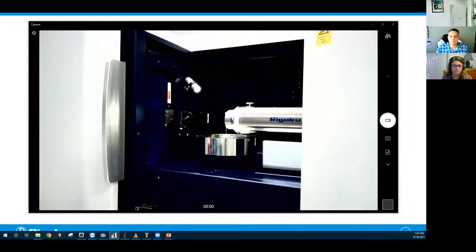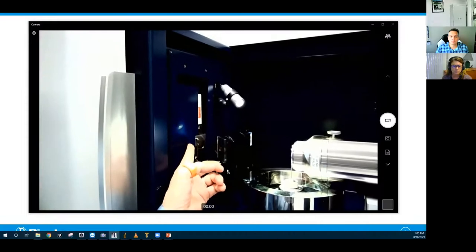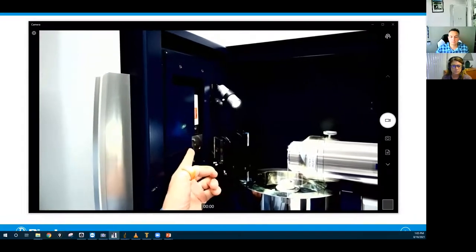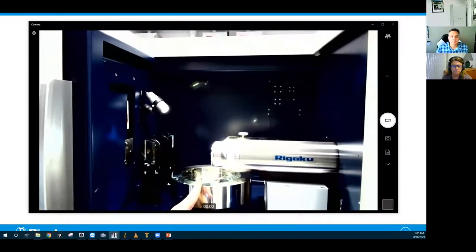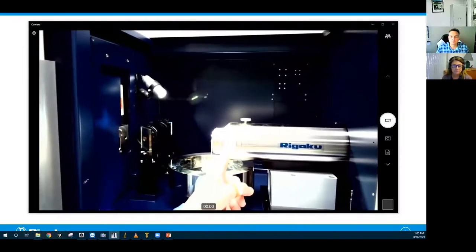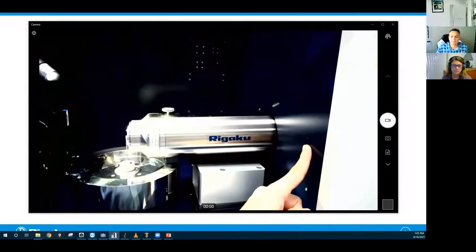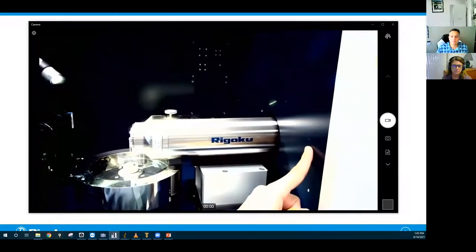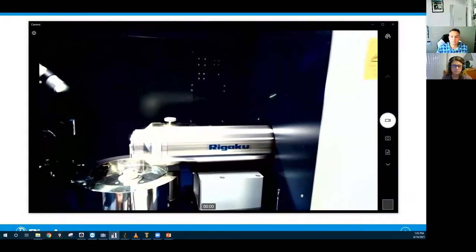And a couple of the important components are hidden behind the panels or walls, but behind this panel, we have the X-ray generator. And this is where the X-ray filter can go in. And this is the sample stage, and it's very bright, but this part has a scintillator in the lens. And behind this panel, we have a detector, and we're using sCMOS. CCD can be used for high resolution data collection as well.